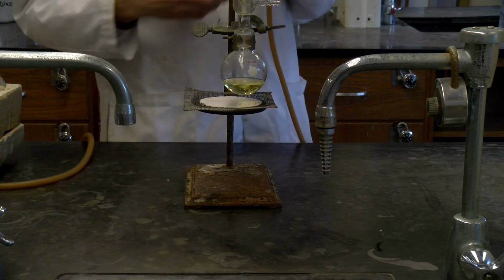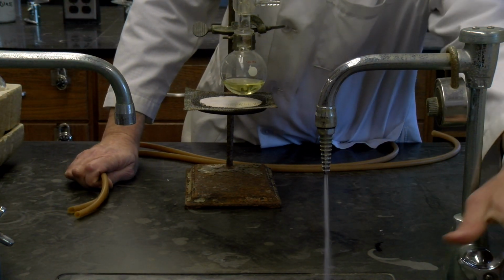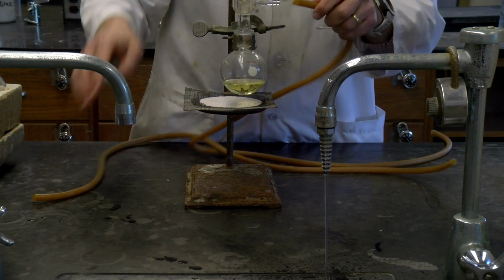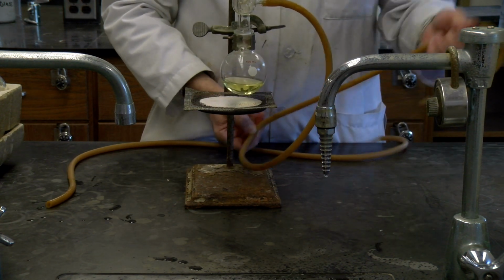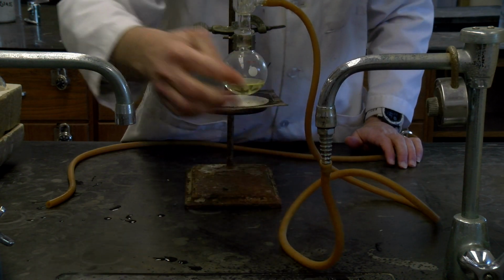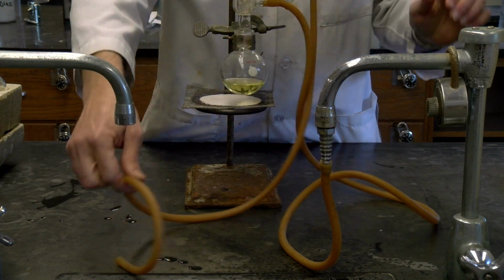And then we want to add water to this, so we have our water tubes. So I'll tell you what I'm going to do is turn this on just a little bit. Wet both sides of this. This helps just getting this on. So I'm going to add these ones. Alright, so the bottom one is where we always add the water. And so that's going to allow the water then to fill and then to come out the top one. And then the top one will flow into the sink.